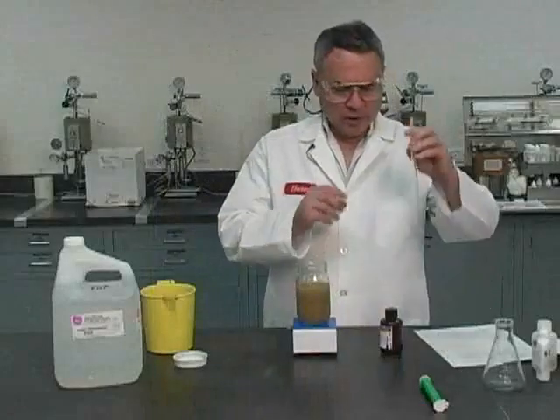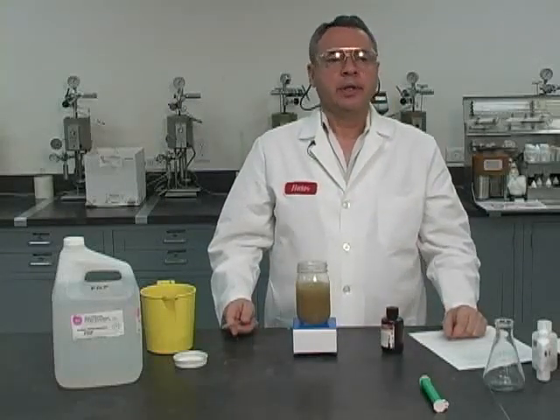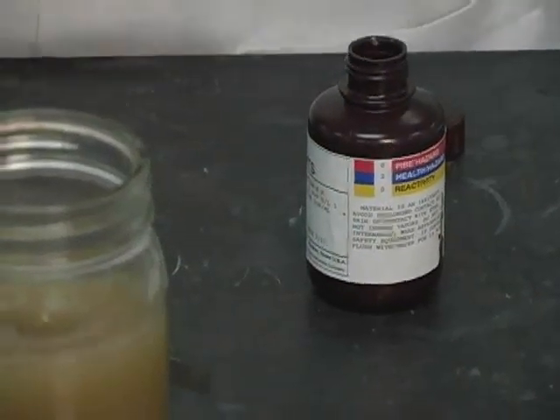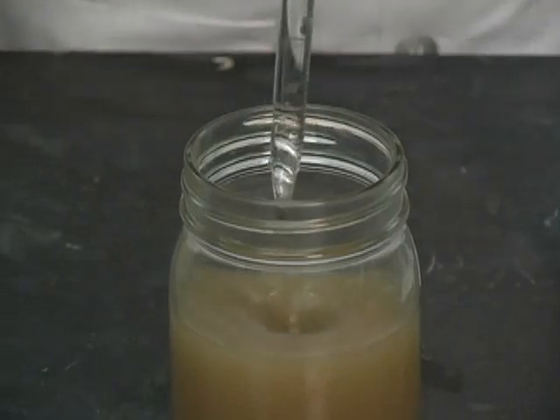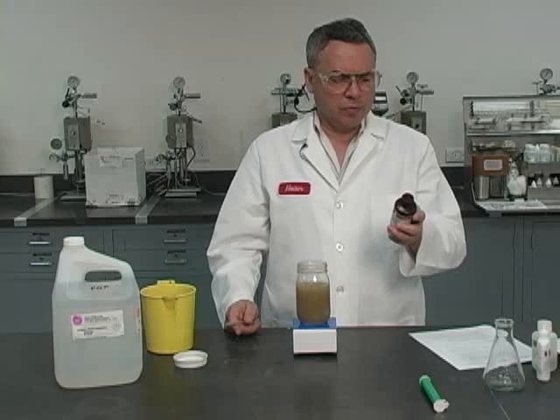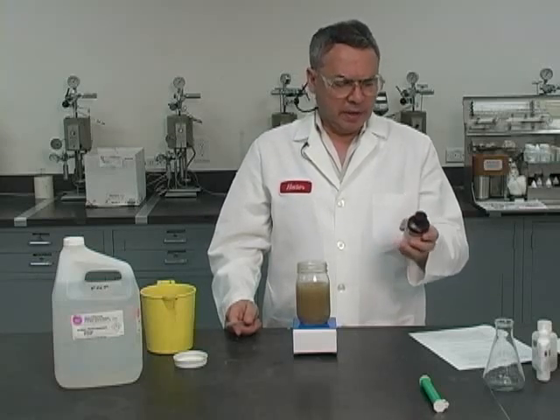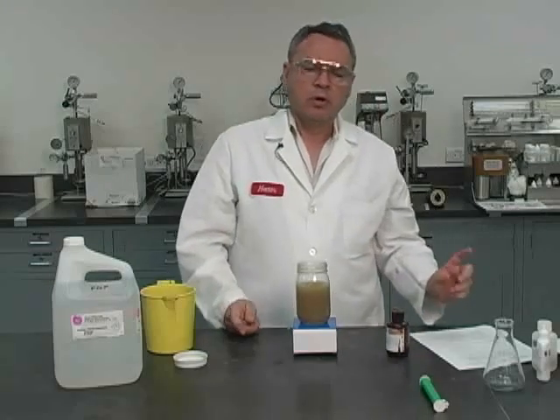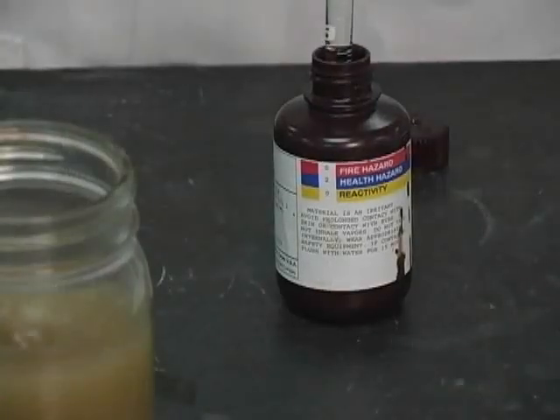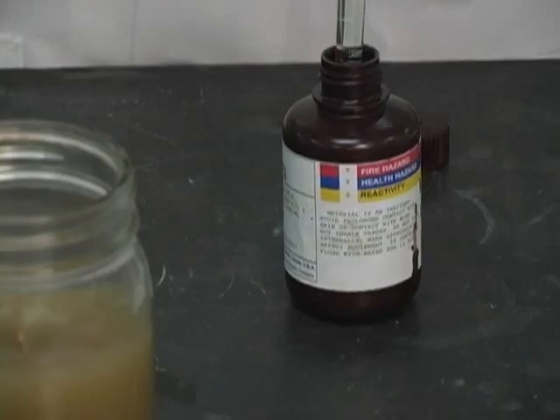So now I'm going to proceed to titrate with silver nitrate, because this is an invert emulsion. I know that the amount of chlorides is going to be very high. So what I'm going to do is use the most concentrated of the silver nitrate solutions, the one that comes as 0.282 normal silver nitrate. That means that 1 cc of silver nitrate is going to be equivalent to 10,000 milligrams per liter of chlorides. So we are ready to titrate. We are going to do this with a 10 cc pipette.